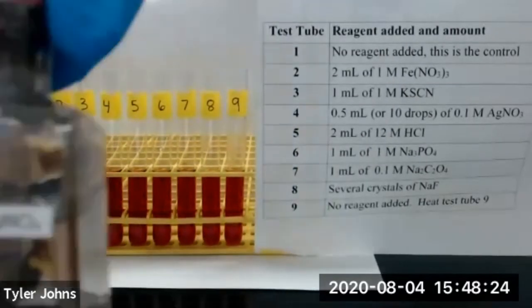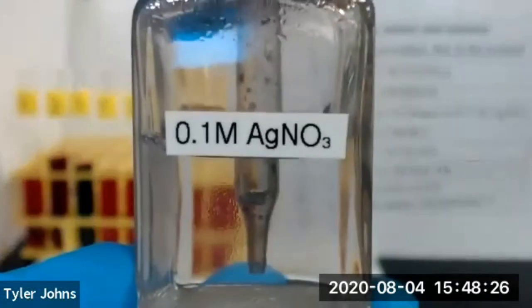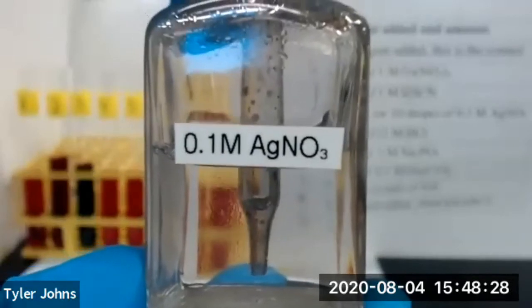We'll next add 10 drops of 0.1 molar silver nitrate to test tube number four.